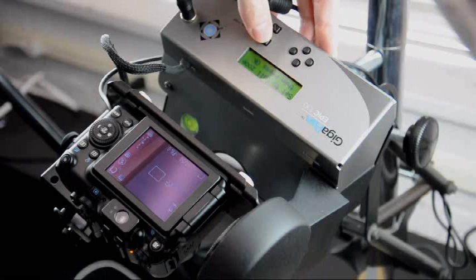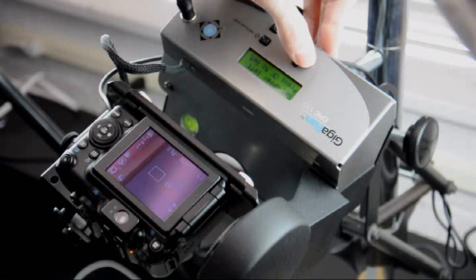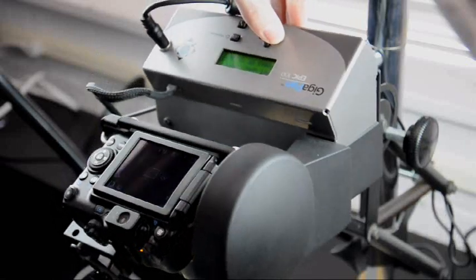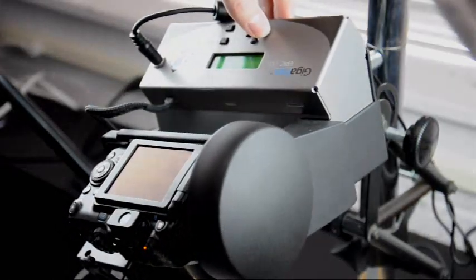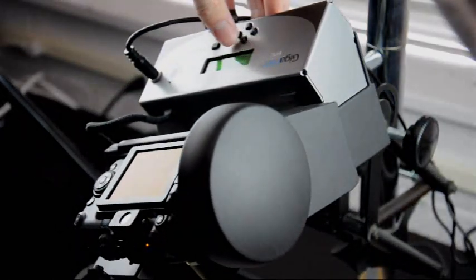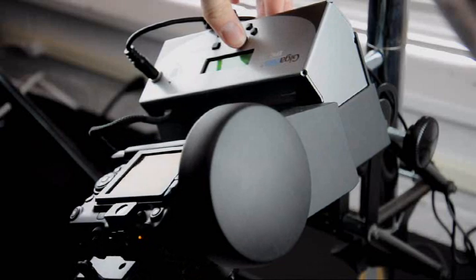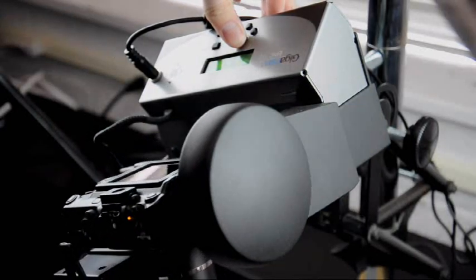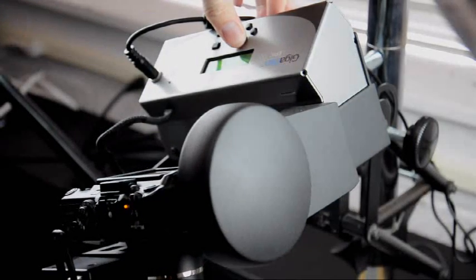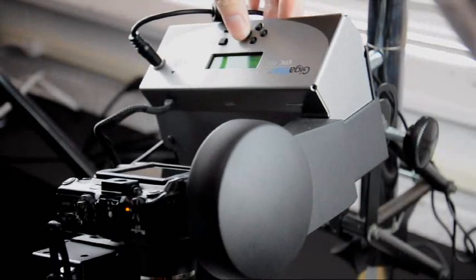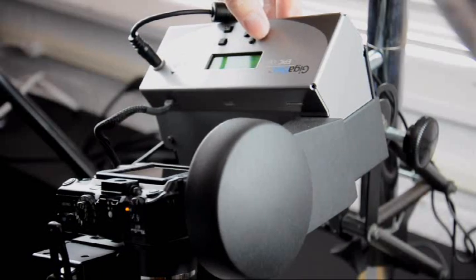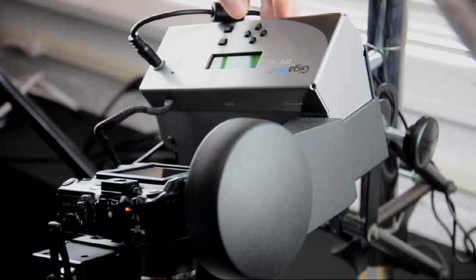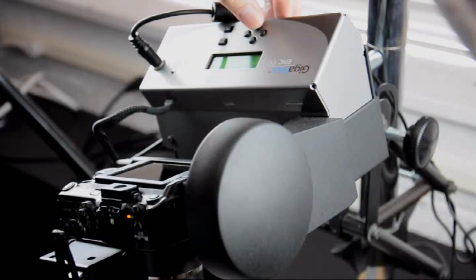After making this selection, the robot will ask several questions on its display, including asking to set the upper right and lower left corners of the area of interest, in this case the entire drawer. The robot will then have the area set up for each subsequent drawer, and it will also calculate the number of images being captured. For our purposes, we capture 35 images, 5 columns, each with 7 images.